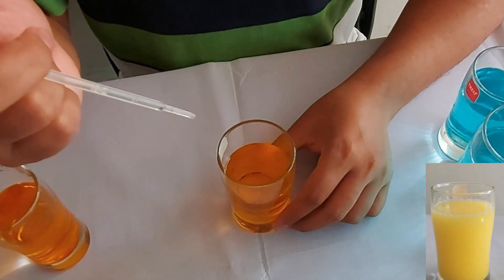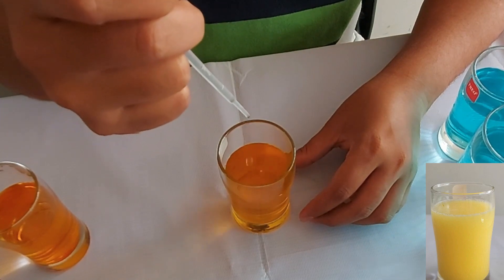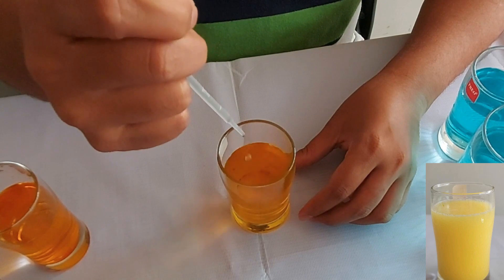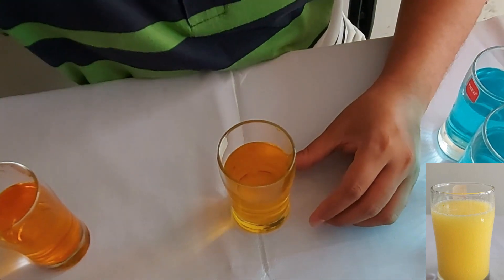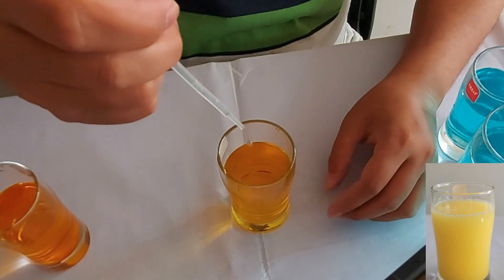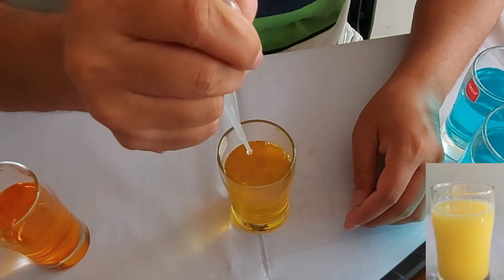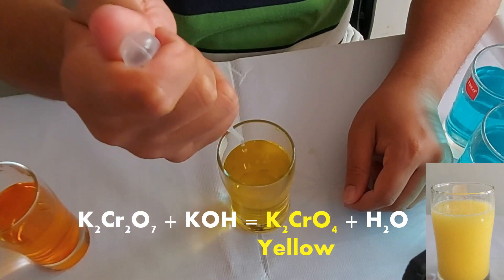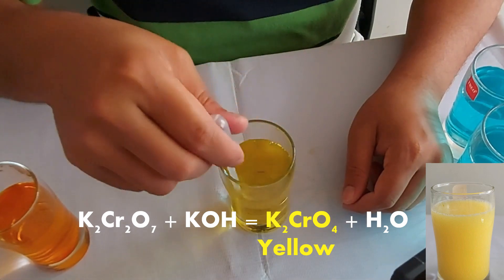Turning yellow color from the orange color — we are adding KOH solution to the potassium dichromate solution. You see we have completely turned this orange color to the yellow color.